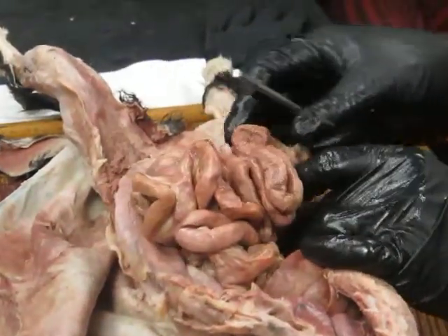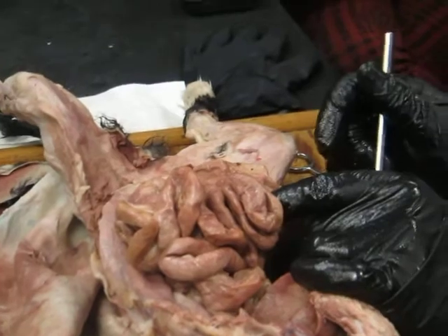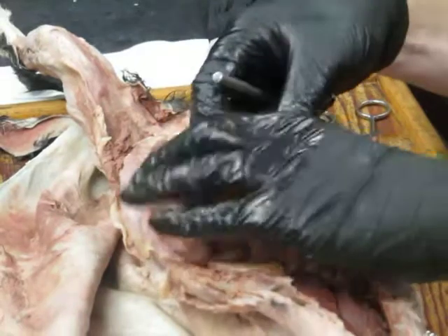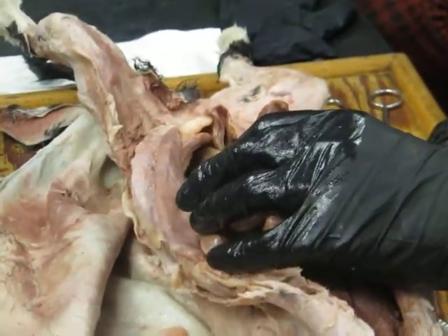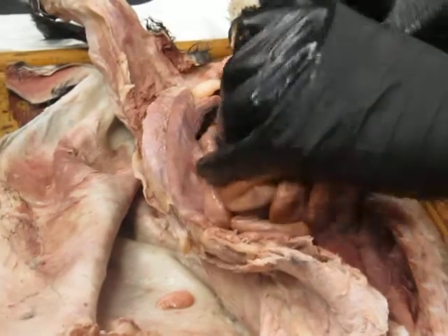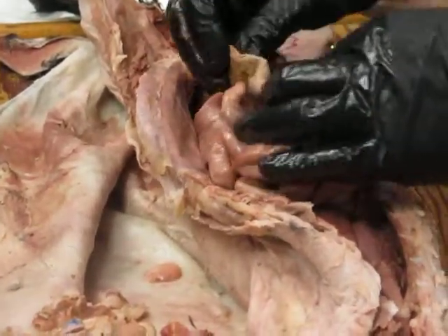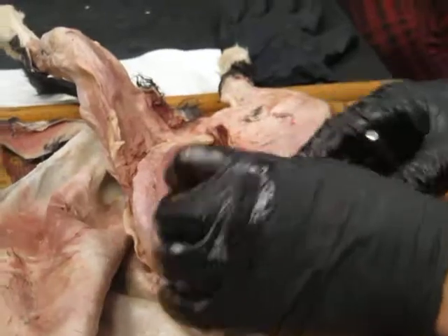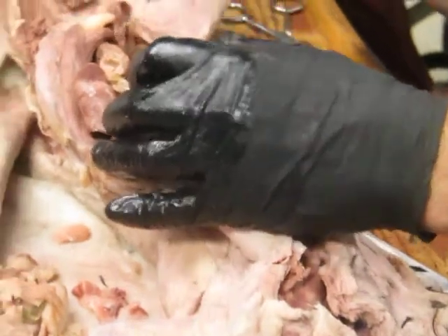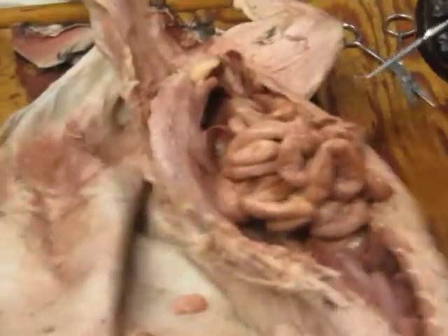Cats are carnivores. Carnivores generally do not have an appendix. So is the appendix for herbivores for digestion? Yeah, they're associated with herbivores that have a big cecum. So basically, if you've got a big cecum, you've got bacteria there, and the appendix has got a lot of lymphoid tissue that helps protect the body from the bacteria that are in the cecum. So then this is the large intestine, or colon, and it's very short in the cat. It basically just runs along, drops down, and eventually as the rectum will connect up to the anus and go out.